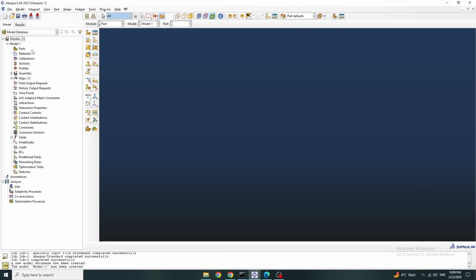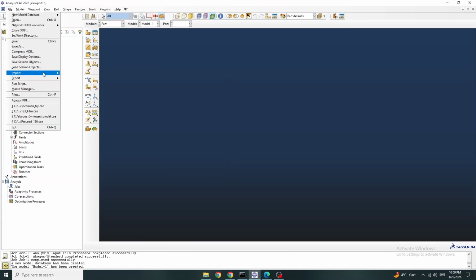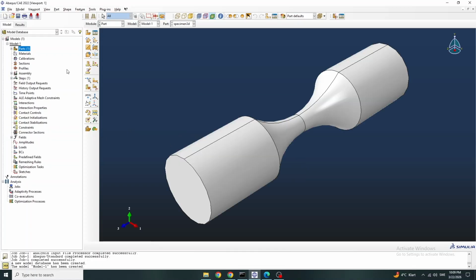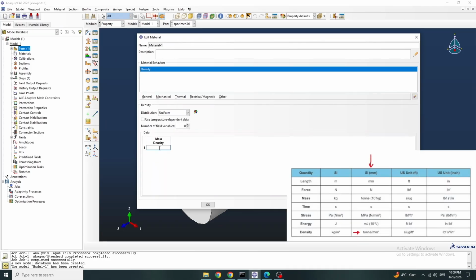Okay, so you can start by creating an axisymmetric part or a 3D part, but for my case, I'm going to import a 3D part that I made in SolidWorks, specimen 3D. Then I'm going to assign a material to it, and remember the units should be consistent. The density is 4429, but it's in tonnes per cubic millimeter, so it's E minus 12.